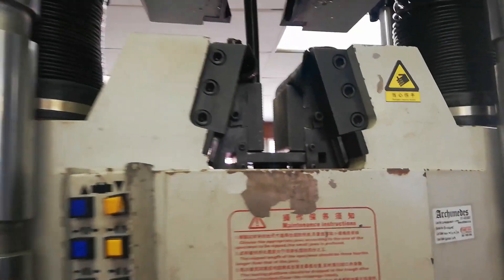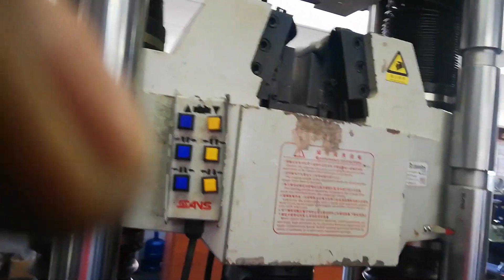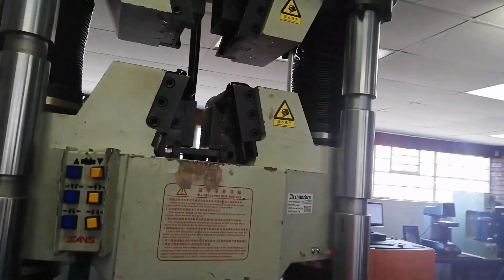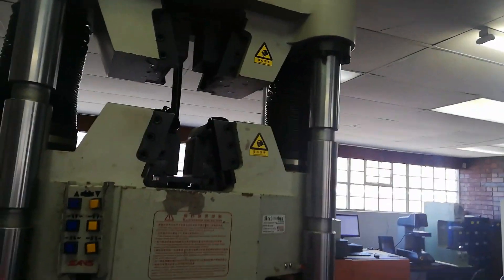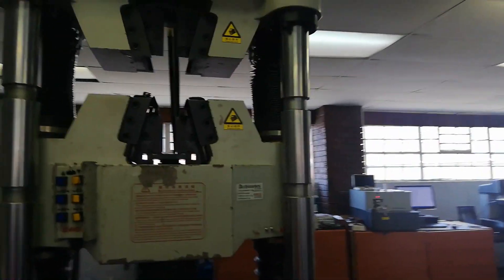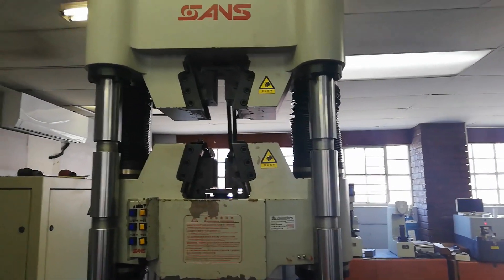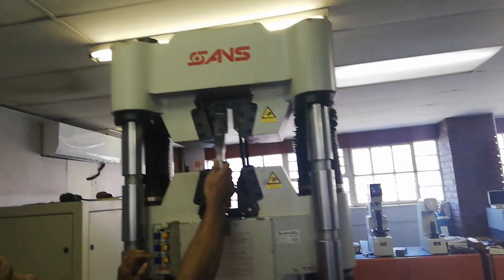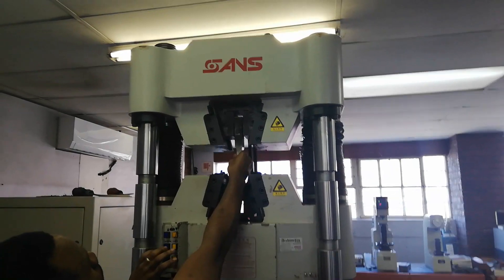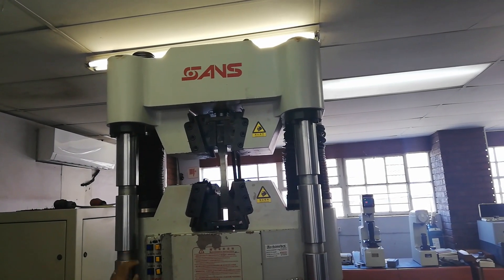After that we're going to go to our machine. This is our machine — you can see the grips, the top ones and the bottom ones. Now what we're going to do is put our sample between the grips and start stretching it until it fractures. I'm going to hold the top of the sample and then the bottom.